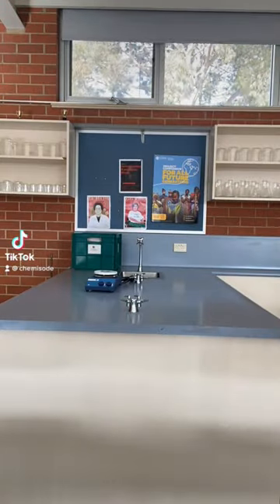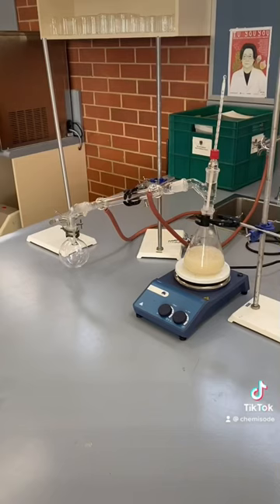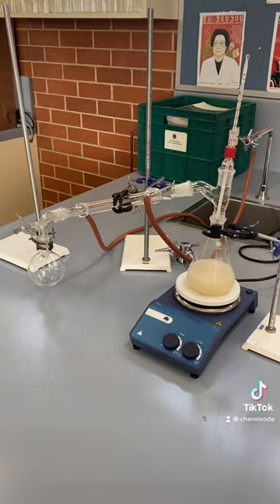In Year 12 chemistry, we finalised the production of our bioethanol, which involved distilling a mixture that I made using yeast and sugar. I started this process about five days ago where I added some water, sugar and yeast to a beaker.